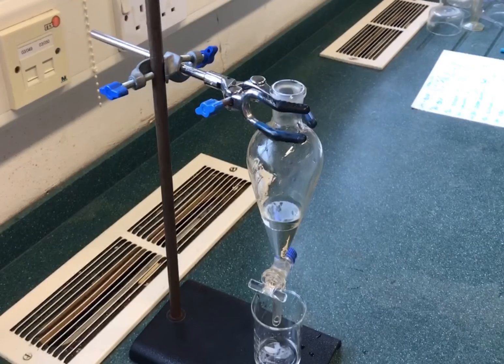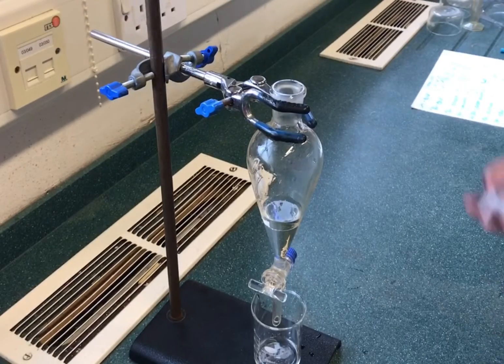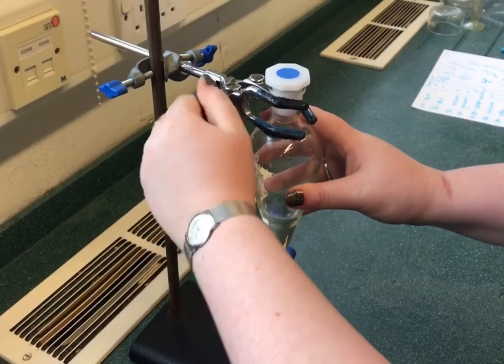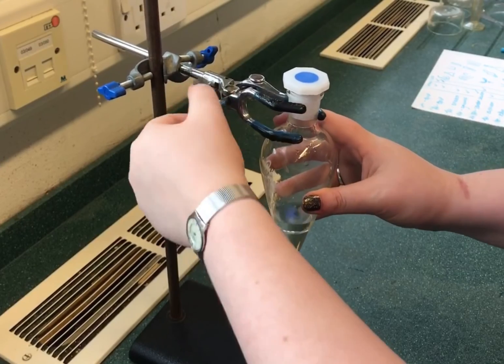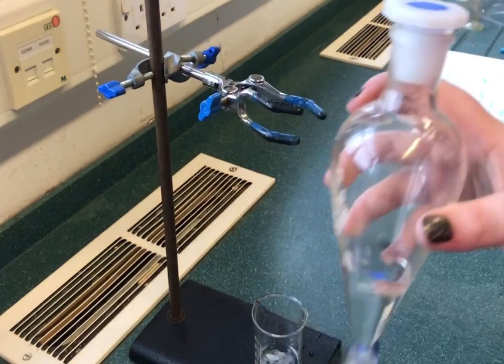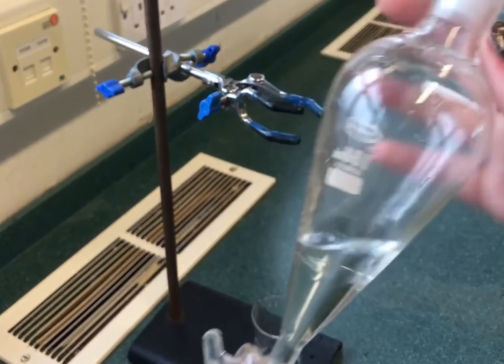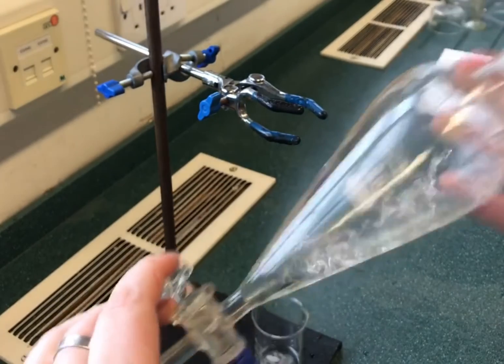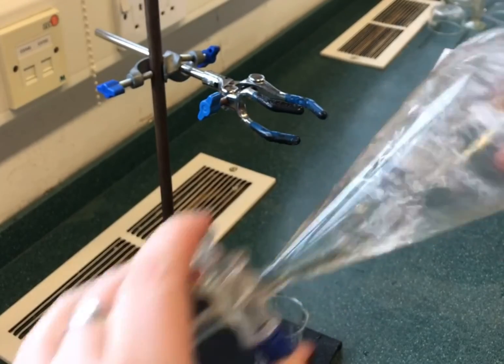The original layer is returned to the funnel with more solvent and the process is repeated multiple times. Repeating with multiple smaller volumes is more effective than once with the total volume. The extracted layers are combined and evaporated to yield the solute.